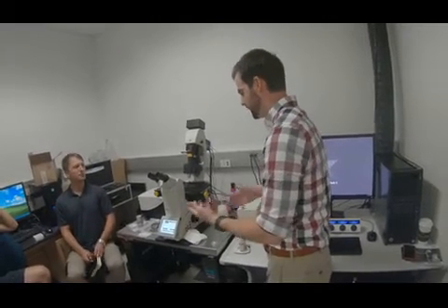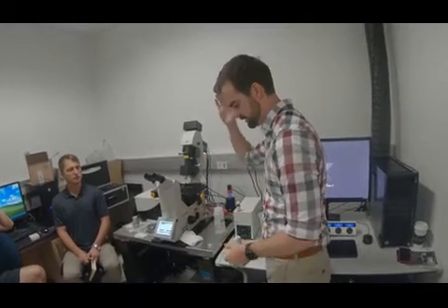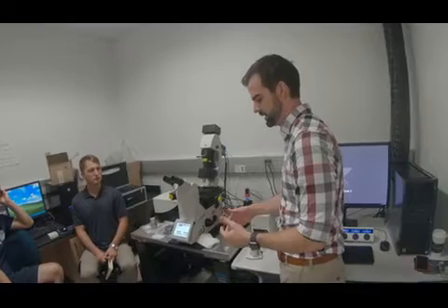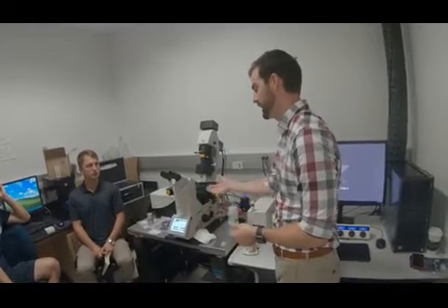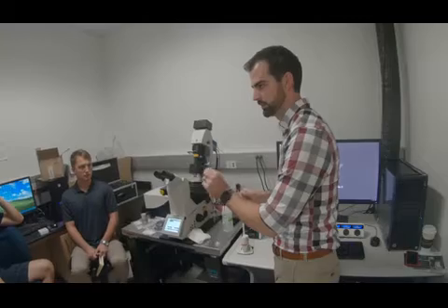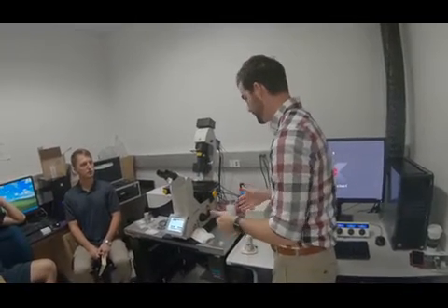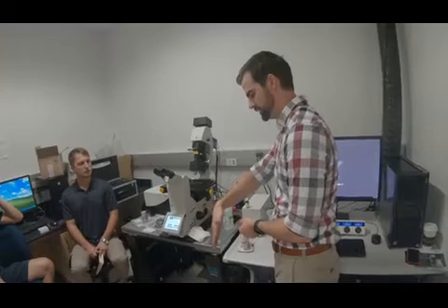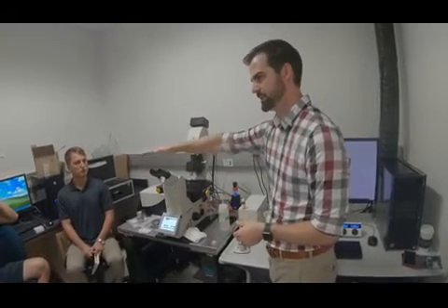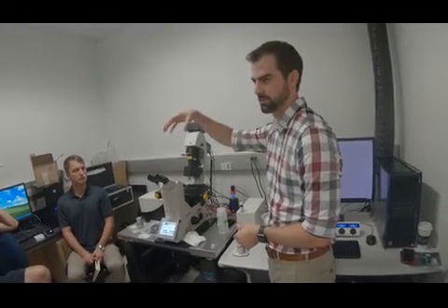With wide field, you view the field of view and excite basically everything at once, and take a picture. With a point scanning confocal, you're exciting a little spot and you raster scan across, so you're exciting very little at one time, but confocal is slow. With SPIM, you basically excite the entire XY plane at once, and then you take a picture of it with a camera.